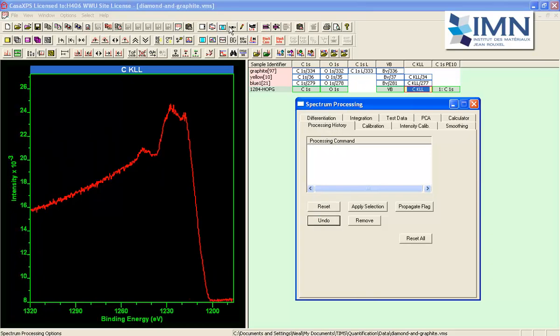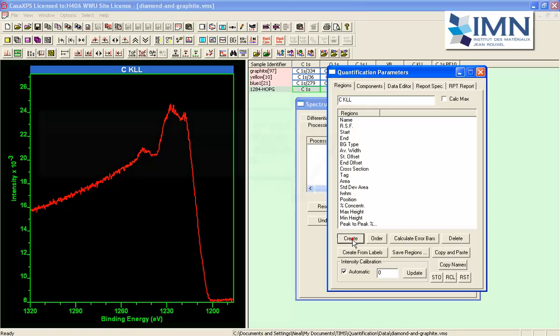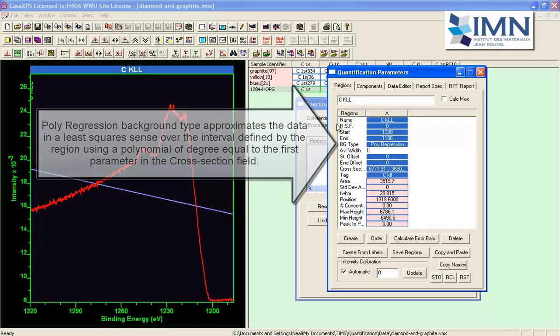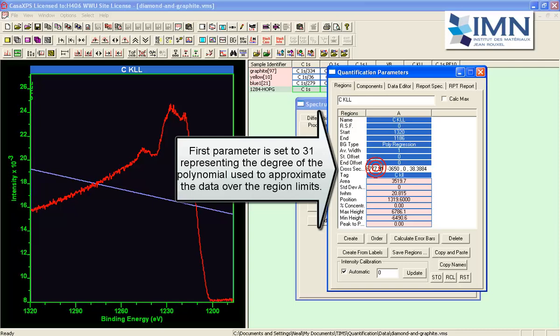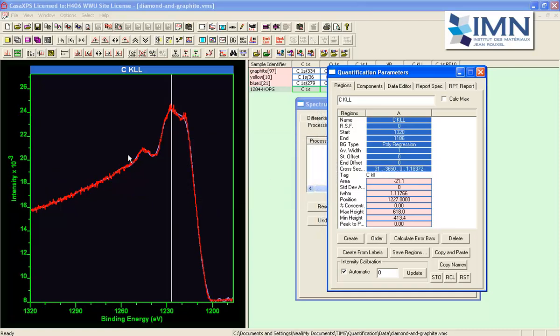if, rather than using a polynomial of degree 2 to approximate the data when we try and work out the derivative, we can create a background type which will use a polynomial of higher degree. So it's the polynomial regression type, and it uses the cross-section parameters, or at least it uses the first one, to provide a degree for the polynomial that will be used to fit the data.